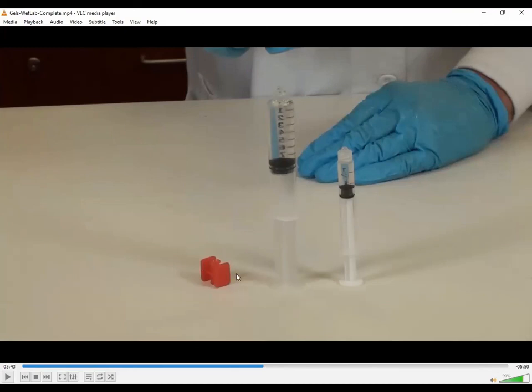You'll see we have these red syringe tip connectors over there. You need one of these. They're not disposable, so don't throw it away. You need to put it back when you're done. Essentially, it has a luer tip connector for the syringes on both ends. So you just twist on the luer tip connector for both. Let's see this example here.